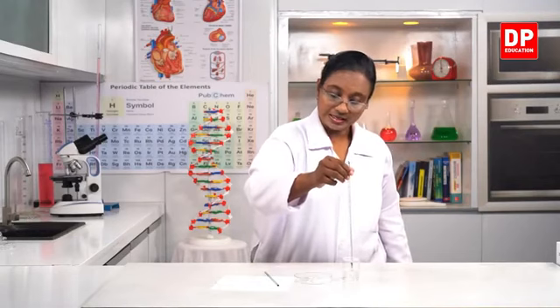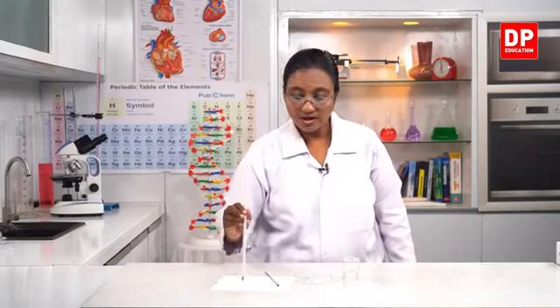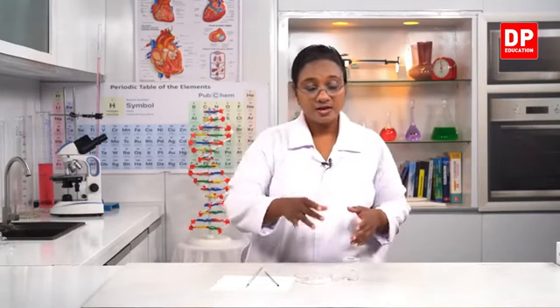So that is the change that you can observe when sodium hydroxide pellets are added to sulfuric acid solution. Initially the temperature was 25 degrees Celsius. Once all the sodium hydroxide pellets dissolved, the final temperature was 29 degrees Celsius. So there you saw a change in temperature, or increase in temperature, as well as you saw the sodium hydroxide completely dissolved in sulfuric acid. So there is a change taking place.